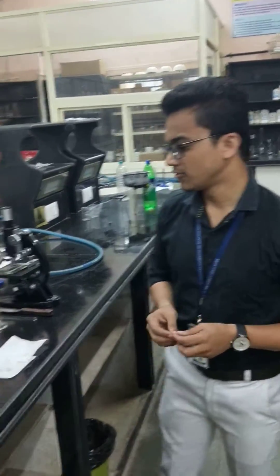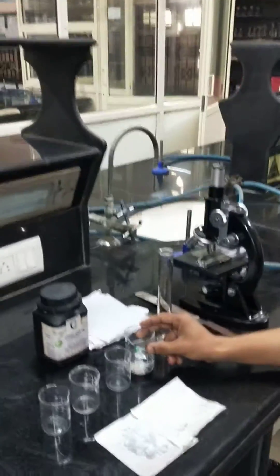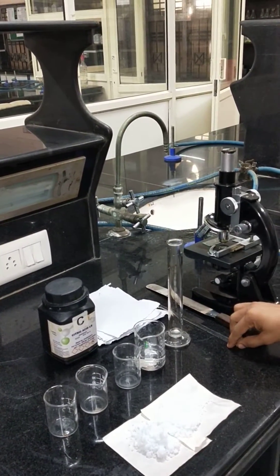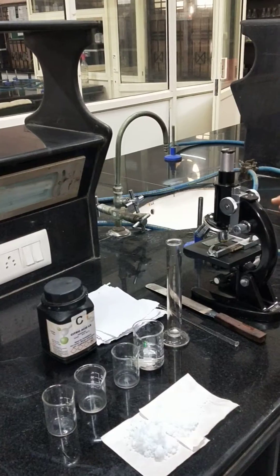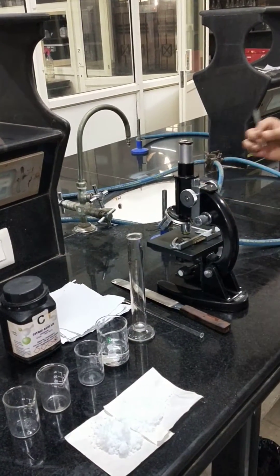The requirements of this practical are: first, a digital balance; different beakers; a measuring cylinder; a glass rod; the chemical citric acid; and a microscope with slide.